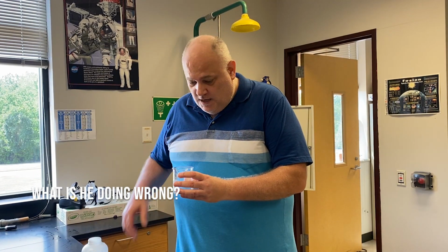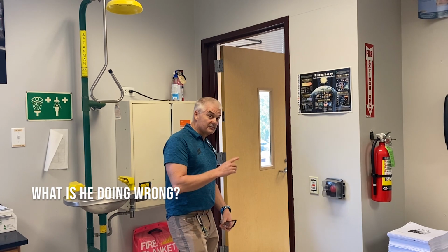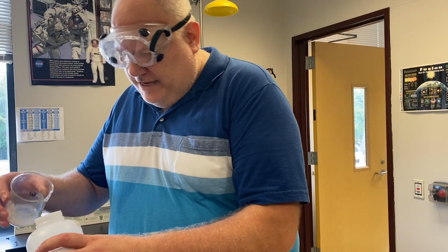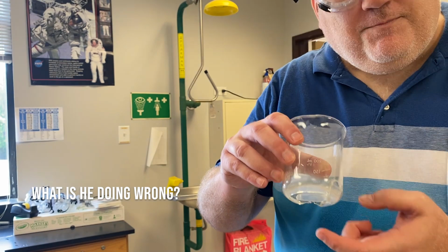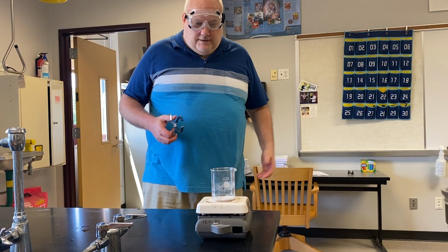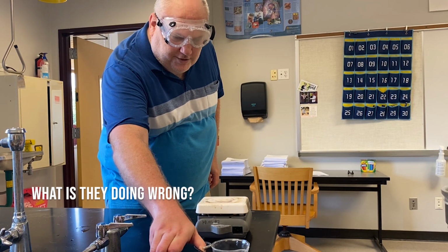Ooh, pretty! Urge to touch, rising, lick. I wonder what's back here. We didn't use all this, so I'm just gonna put it back in this to save. I know there's an opening, but if I can just maneuver this, I think we're probably okay. I mean, it's kind of okay, right? Man, this is incredibly hot. I'm going to make sure that I take it and put it in a safe spot here, right near the edge.